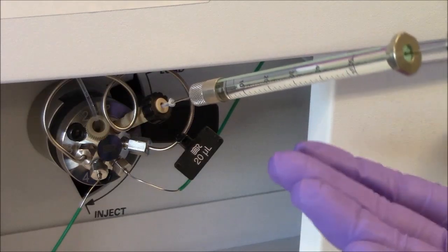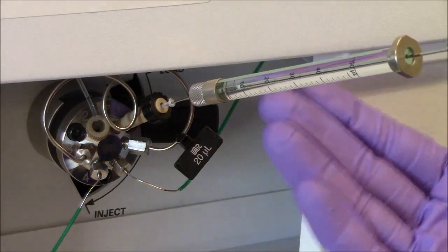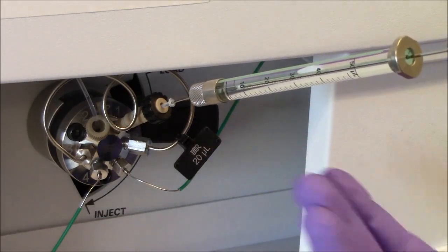I'll leave the syringe hanging here. That's sort of a system I have of saying, I know I injected my sample because here's the syringe.